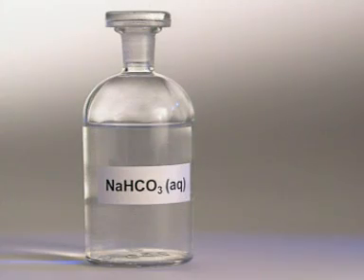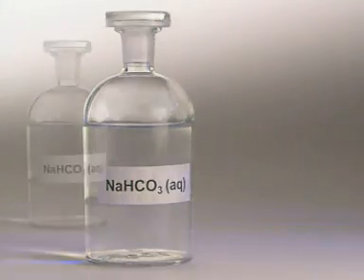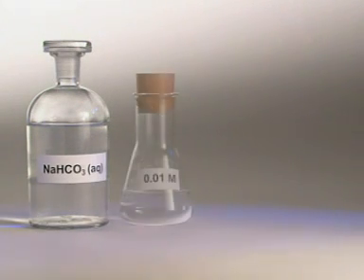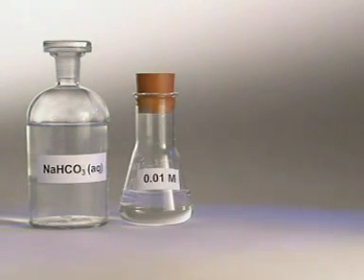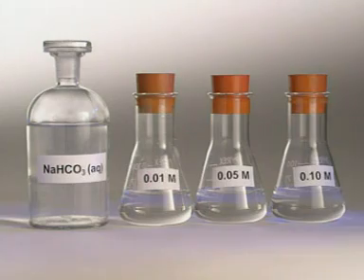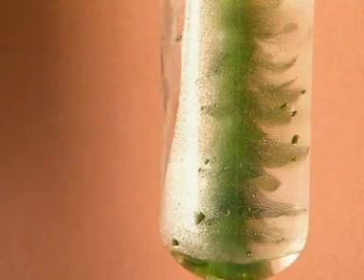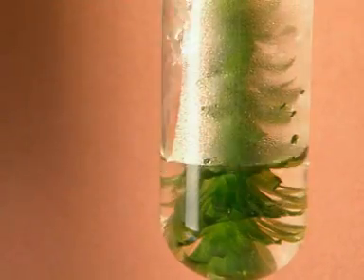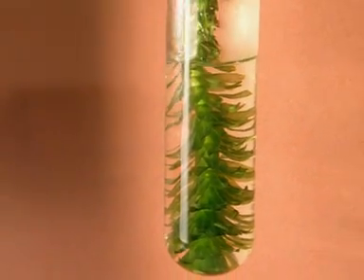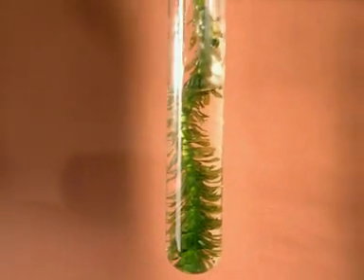A good source of carbon dioxide is sodium hydrogen carbonate solution. The greater the concentration, the greater the amount of carbon dioxide available to the pondweed. To begin with, the plant is immersed in a 0.01 molar solution.